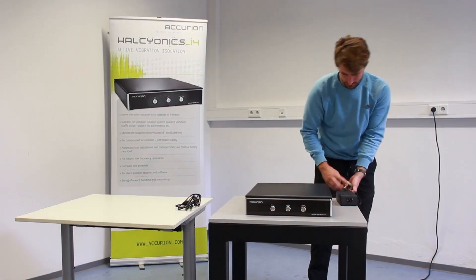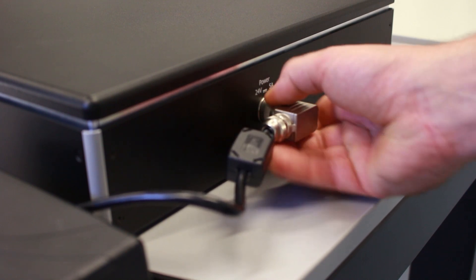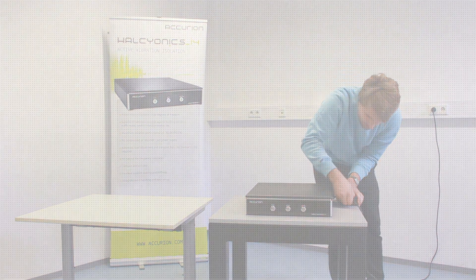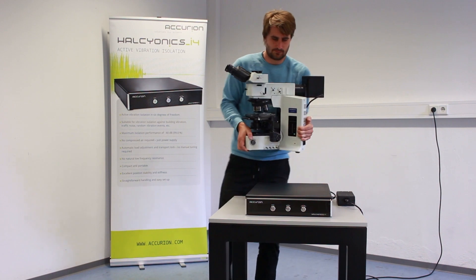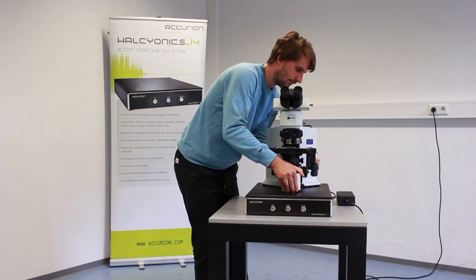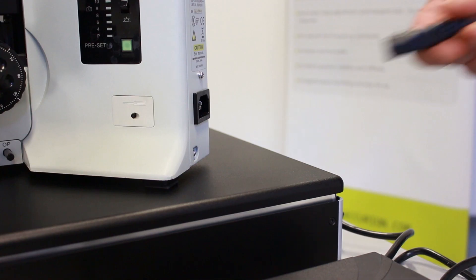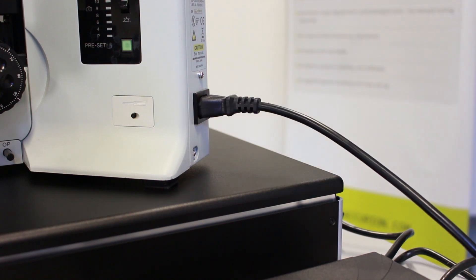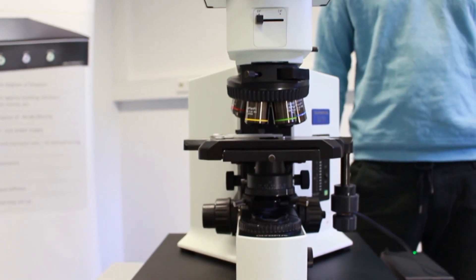To proceed, connect the external power supply to AC power and to the i4 system. Center your application on top of the i4 and ensure that all cable connections are properly strain relieved. Furthermore, the footprint of your application should not exceed the dimensions of the isolator.